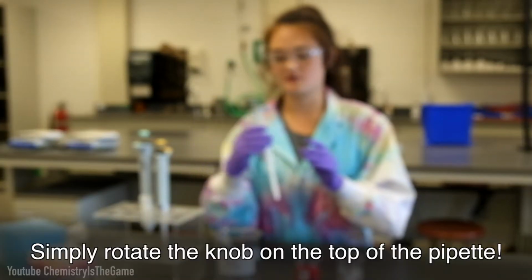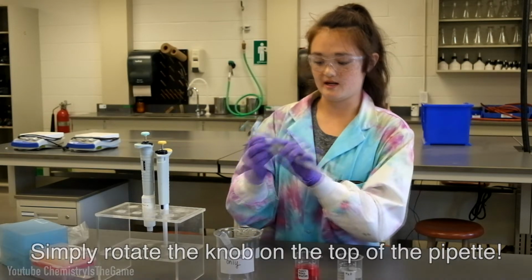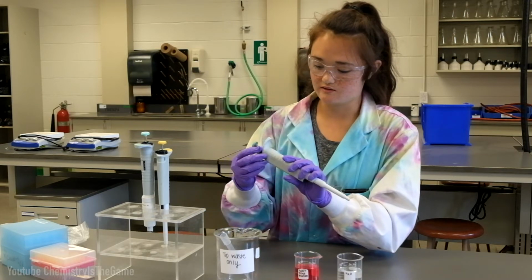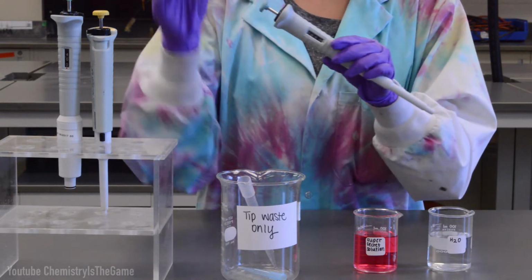First step, you want to set your pipetter to the volume that you want to pipette. I'm going to pipette 800 microliters with a P1000. So this little gauge here tells you what volume you're pipetting. The upper number shows you your upper range.